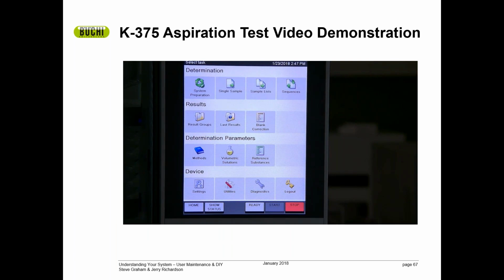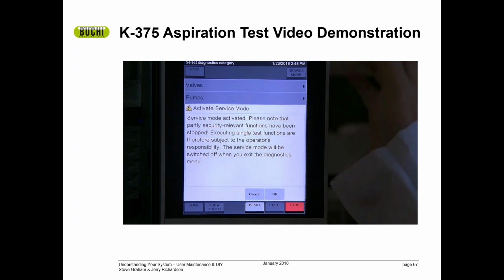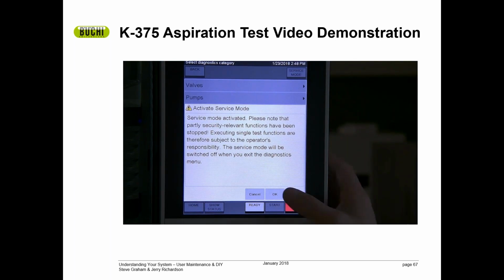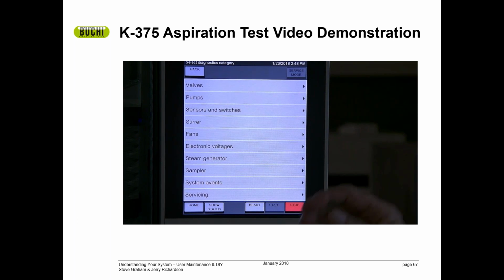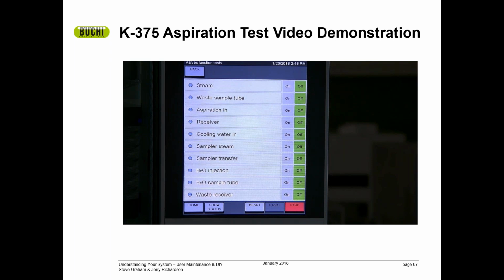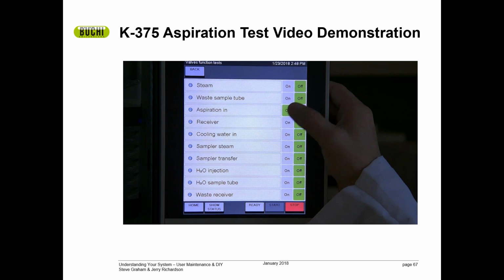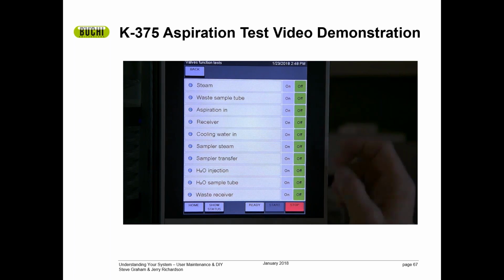So let's see what the K375 software looks like on the instrument. Here we are on the home screen. We're going to go down here to the diagnostics tool. From diagnostics, we're going to go to service mode. In service mode, we have to tell it, yes, we really do want to run in service mode. At that point, we have access to all of these different parts of the instrument. We're going to look at the valves section. In the valve section, what we're interested in is the aspiration valve, and you can turn it on and off and listen for the click of the solenoid.